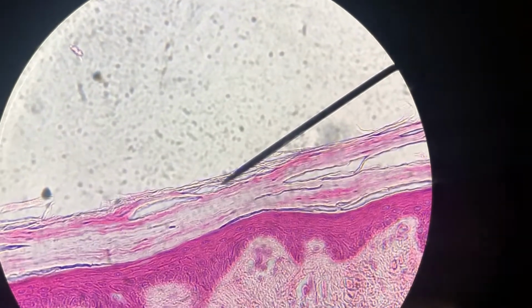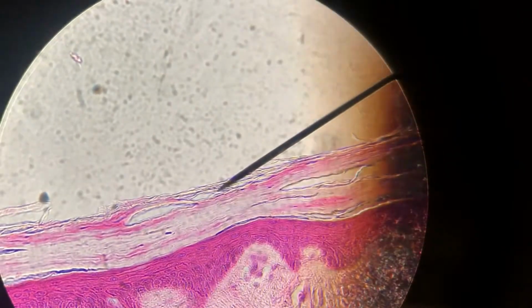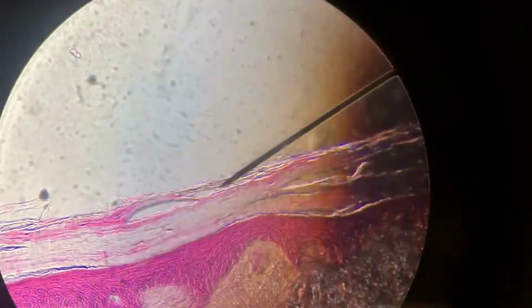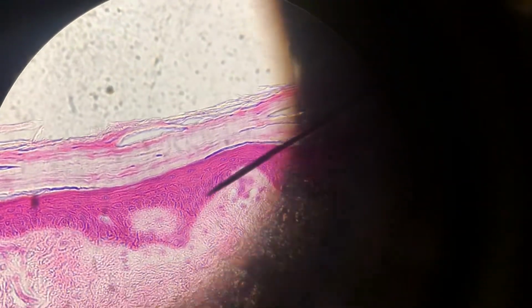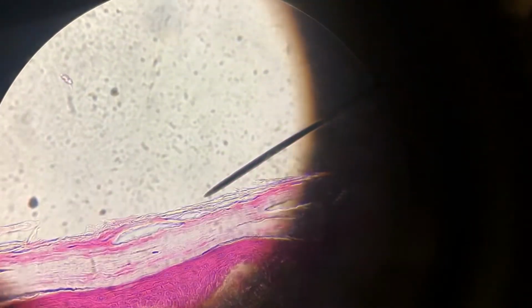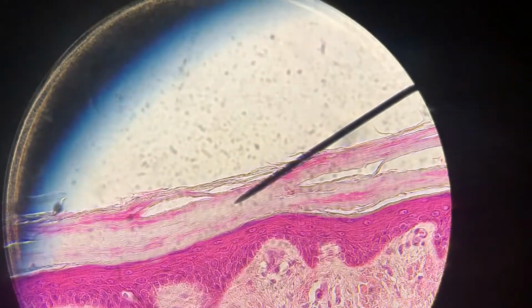Okay, so this is our keratinized version of stratified squamous epithelial tissue. And again, you can see that it's squamous because those cells on the apical surface are really flat. And we can tell that it is stratified because we've got so many layers. So here's the basal layer, and this is the apical surface. And you can tell that it's the keratinized version because it's dry. And how can I tell that it's dry? Look at that. Compared to the last version, totally dry on top. Those 20 to 30 layers of dead skin cells right there.